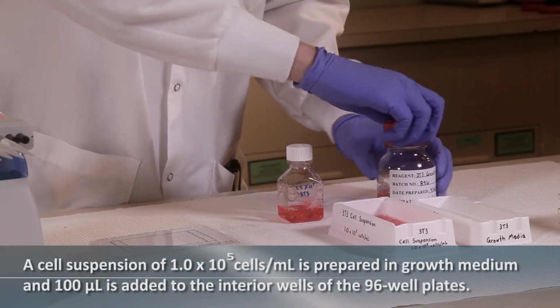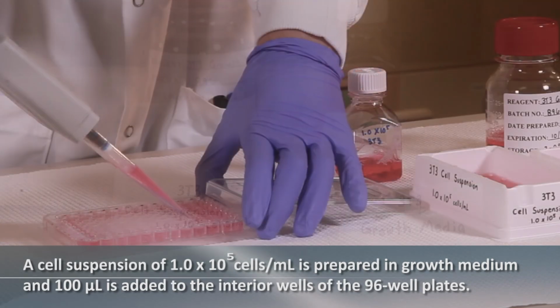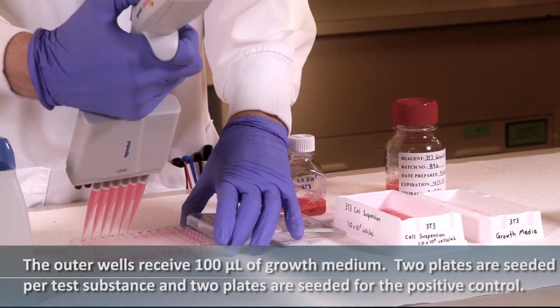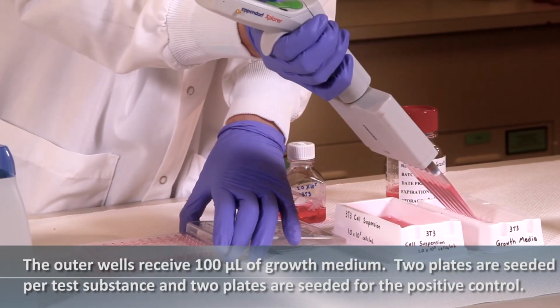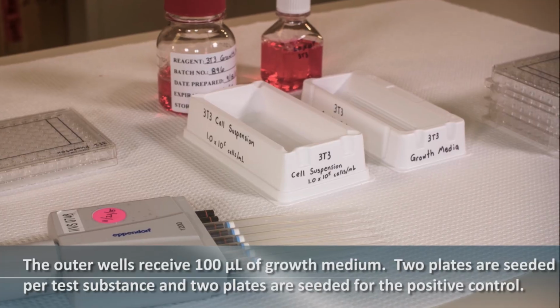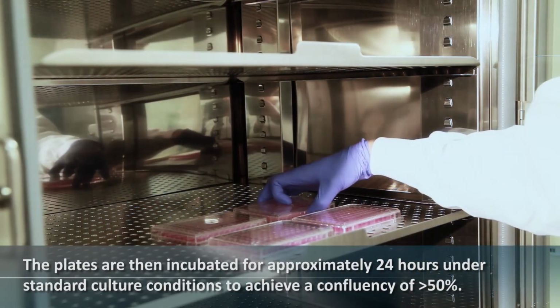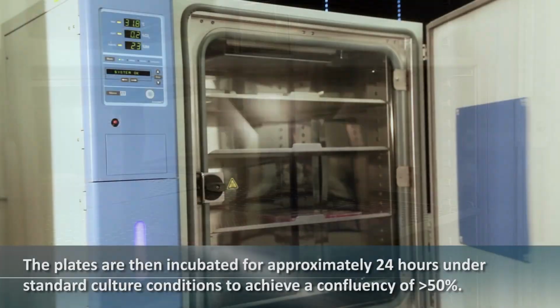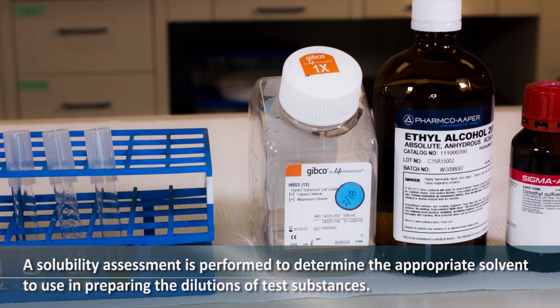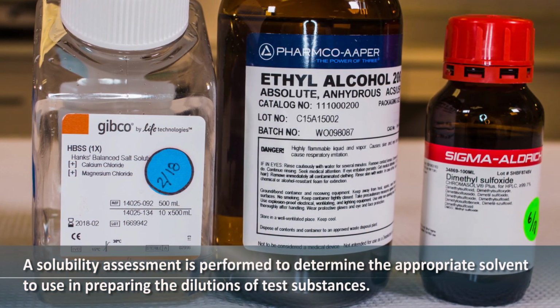A cell suspension of 100,000 cells per milliliter is prepared in growth medium, and 100 microliters is added to the interior wells of the 96-well plates. The outer wells receive 100 microliters of growth medium. 2 plates are seeded per test substance, and 2 plates are seeded for the positive control. The plates are then incubated for approximately 24 hours under standard culture conditions to achieve a confluency of greater than 50%.